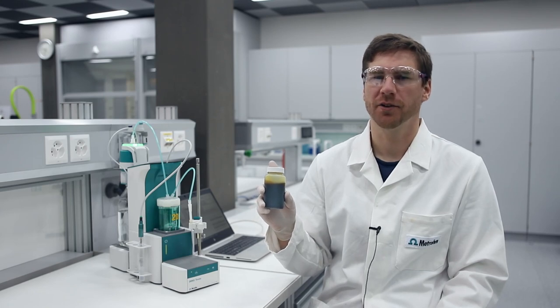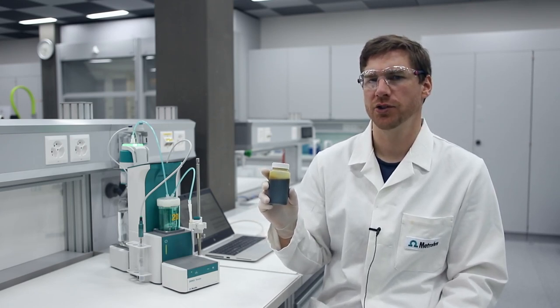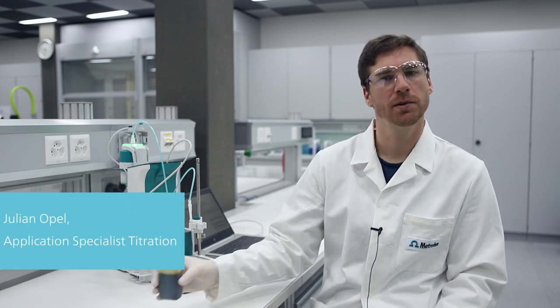Do you analyze the acid number of petroleum products by potentiometric titration? Do you have issues with the reproducibility of your results? My name is Julian Opel. In this first part of this tutorial, I will give you four tips focusing on the cleaning of the electrode. This will help you improve the accuracy and reproducibility of your results.